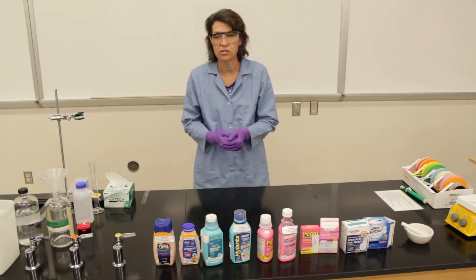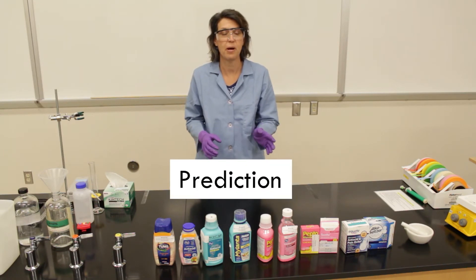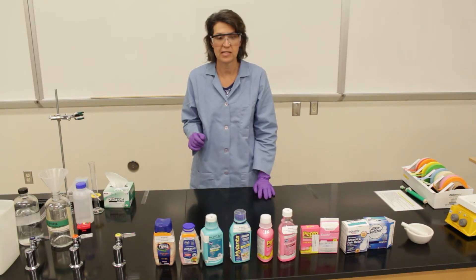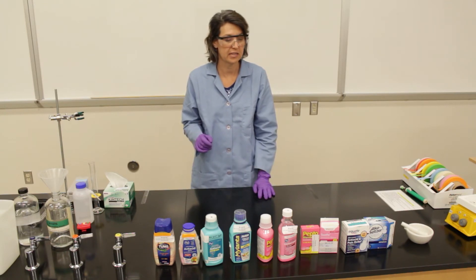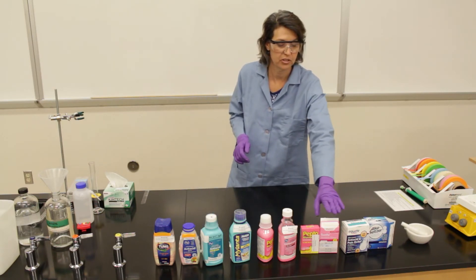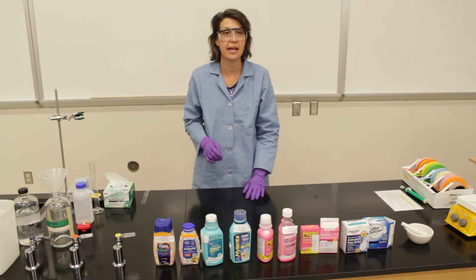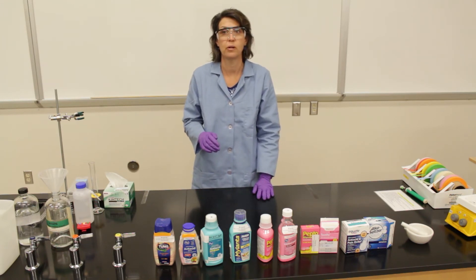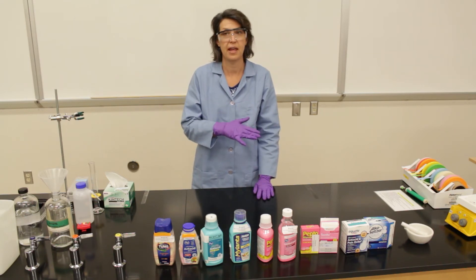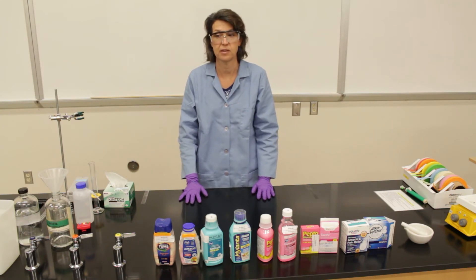On your worksheet there's a space for a prediction. A prediction is like a hypothesis, but it's much more specific. For example, if I say I'm going to test Alka-Seltzer versus Pepto-Bismol tablets, and I say I expect that the Pepto-Bismol tablet will increase the pH of stomach acid more than the Alka-Seltzer will increase the pH of the stomach acid.